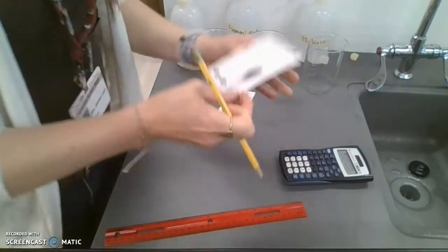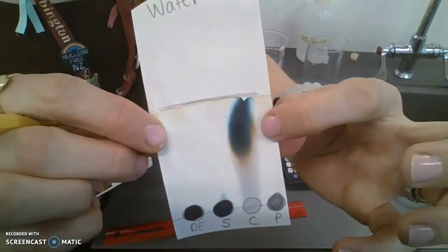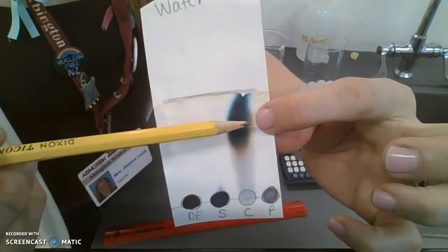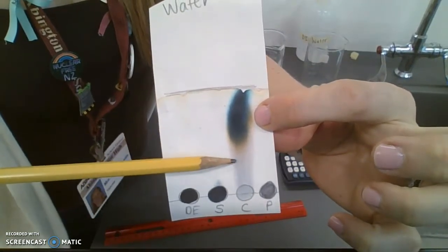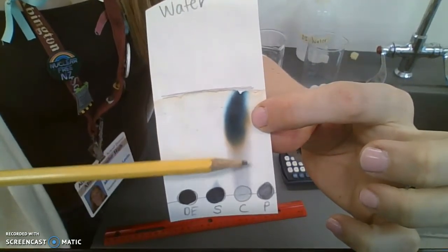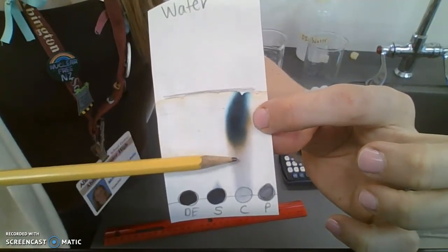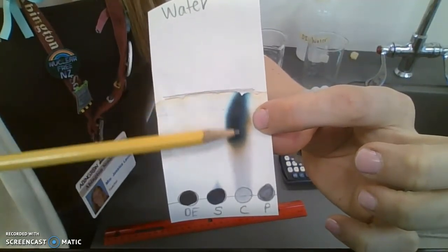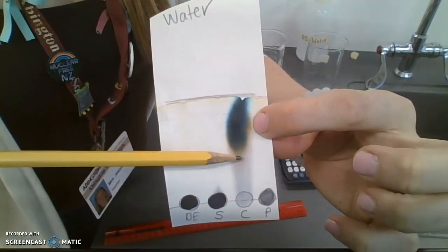You'll see that the pigment here, this black pigment, started to separate into two different visible colors. You can kind of see this hue of red down here, but I don't see it pronounced enough. Some Crayola markers show very bright red, yellow, and blue - these three primary colors all put together to make black.